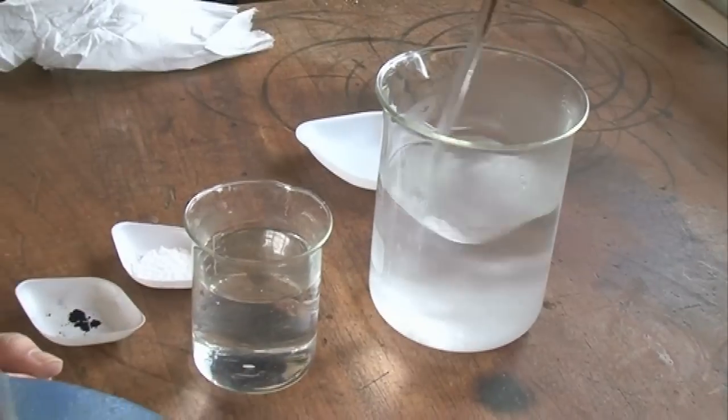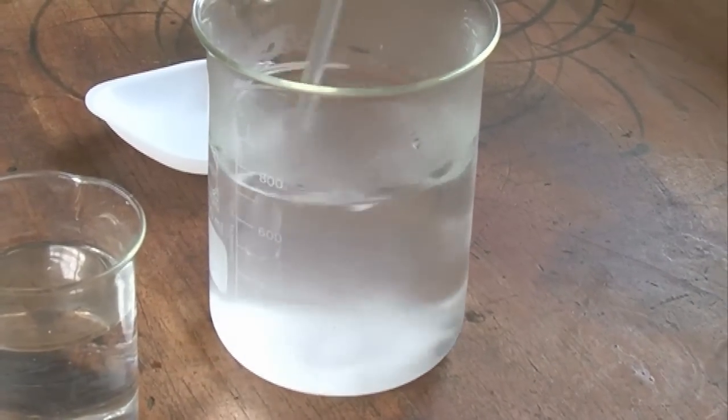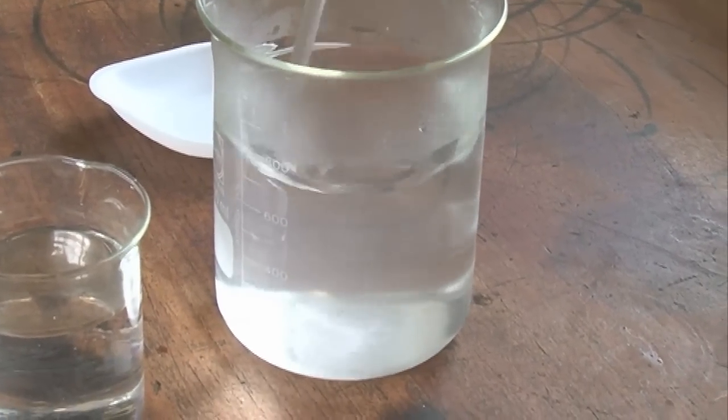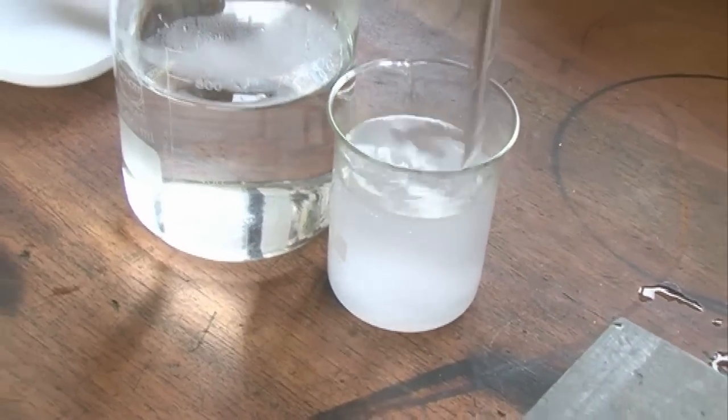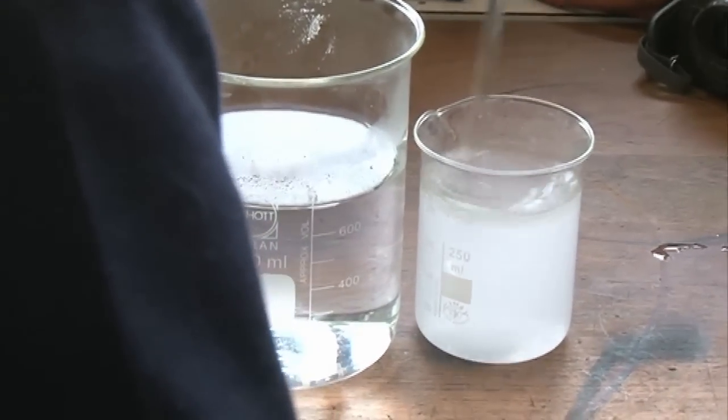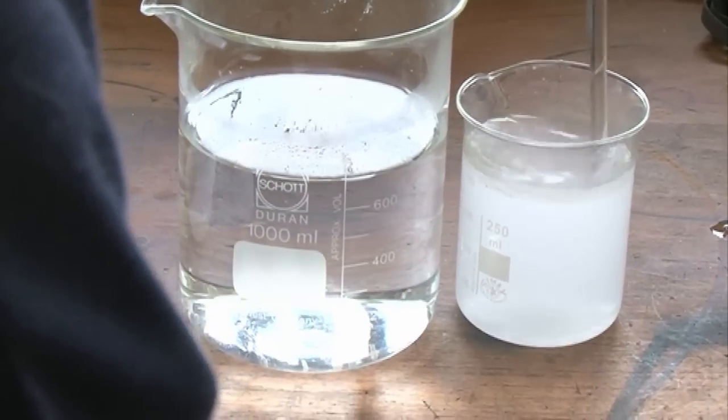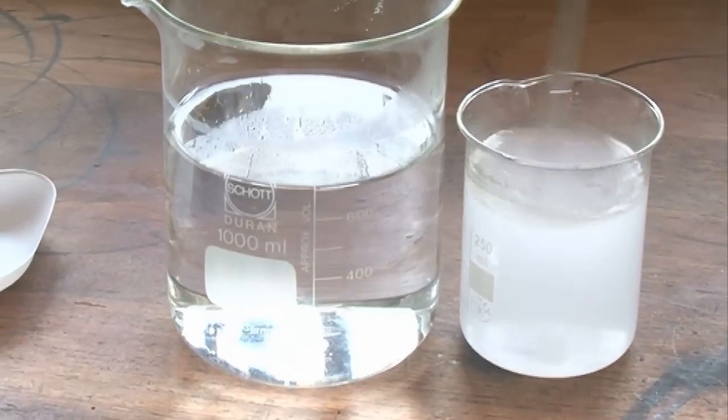We give that a stir. You can see there it clouds up and you've got all the sugar dissolving in the water. This is going to need a stir as well. You've got larger particles of sodium hydroxide this time, and the water is cold so it's going to take longer for it to actually dissolve in the water.